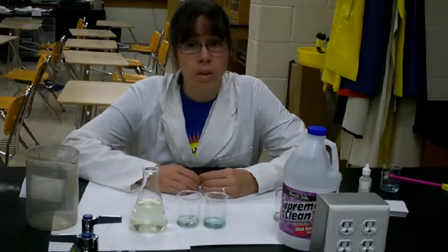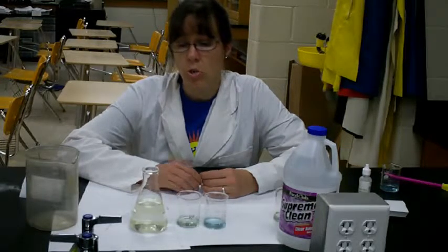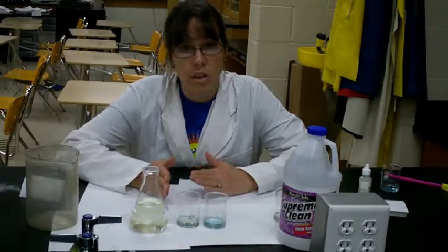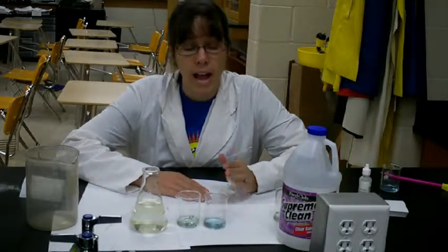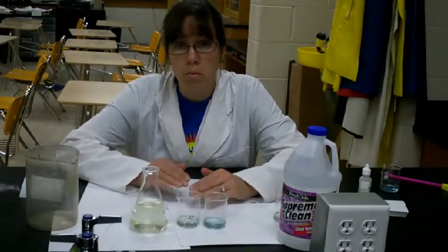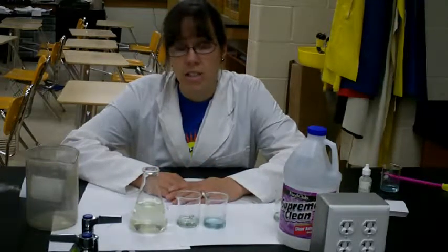Another thing, if you want to be very particular on this experiment, that you might want your students to do, and also depends a little bit on the strength of your stock solution, if your volume in your test jar is starting to get too high, you might want to add additional plain water to your control, so that the bromothymol blue is also at the same dilution as in your test.